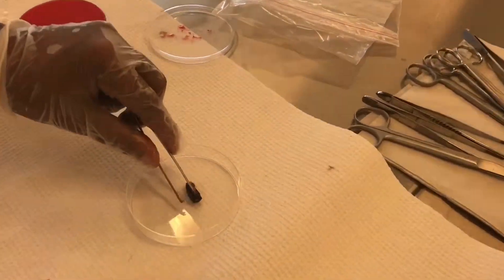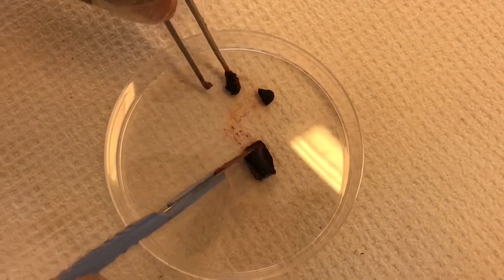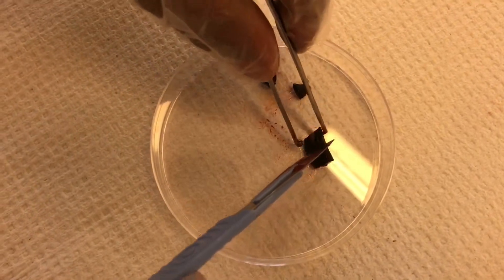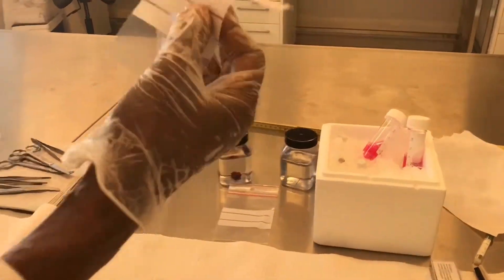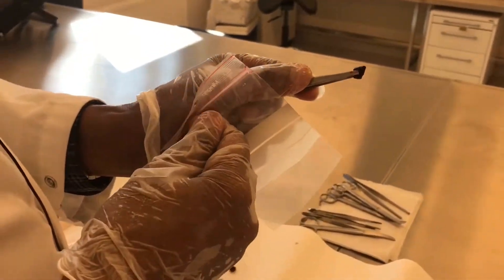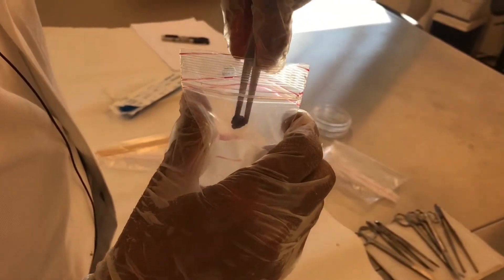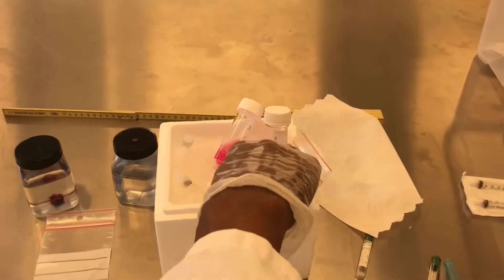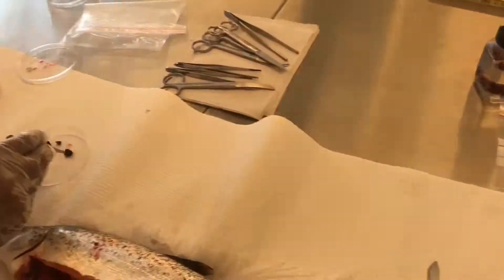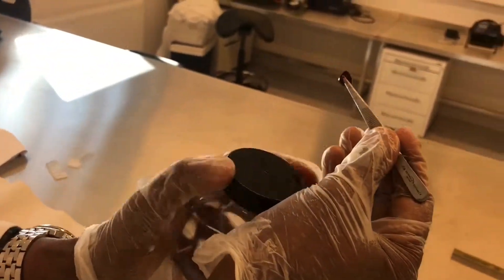Using another petri dish, we can take spleen samples into transport medium, into an empty Eppendorf, or into an empty plastic bag for culture or molecular examination. We should not forget to label all samples at the end. The rest will go directly to formalin for histology.